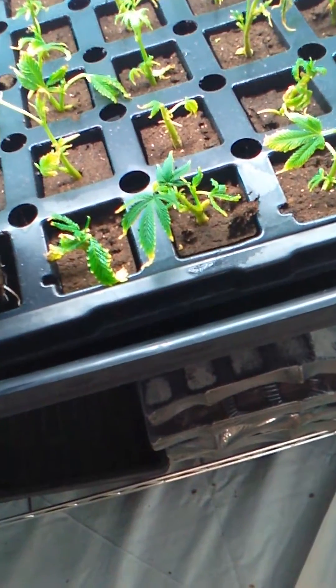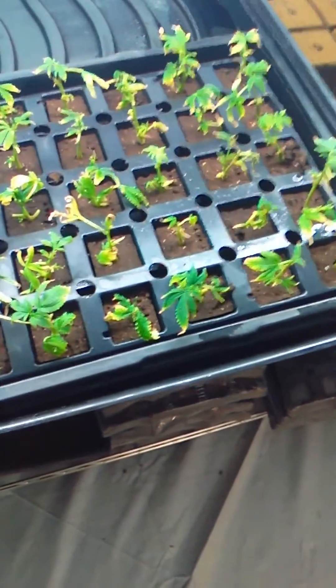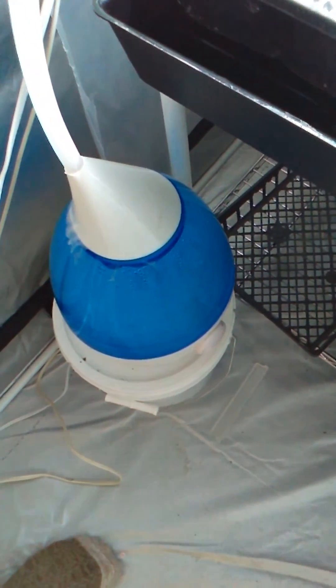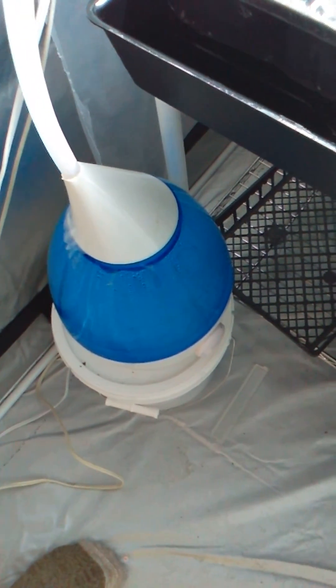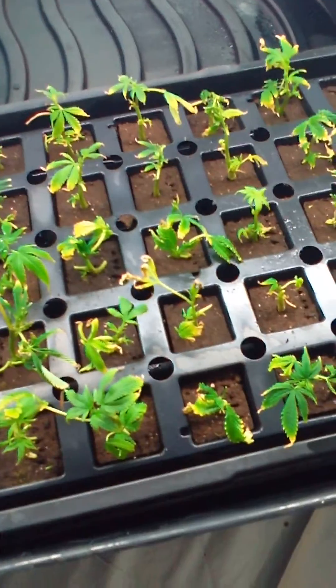These guys have been in here for about two and a half weeks. These are tissue culture roots. I hate taking out plants because you can see, look at that broken root. But it's worth it because everyone really needs to see what the hell is going on. I'm going to take care of these and develop the rest of these roots. Got a root? Yeah. They're ugly. I trimmed away a lot of foliage. This was the failure garden. Oh my God. This fogger quit after I walked out the door and I was gone for a week. So all I had was this little guy keeping this entire tray fogged and these guys still lived.